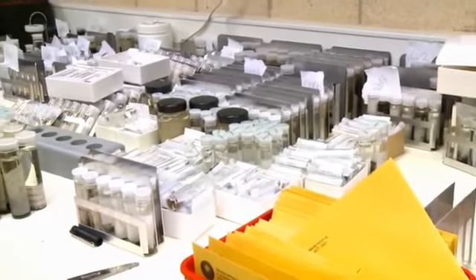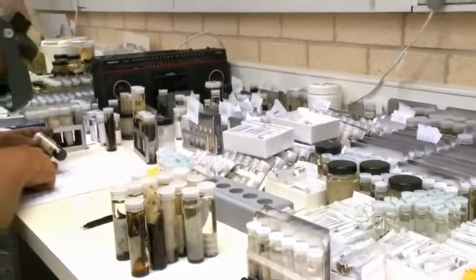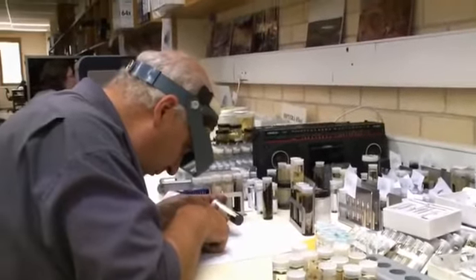The pollen microscope is also expected to make a big contribution to a very ambitious project. The Atlas of Living Australia is going to be the largest integrated aggregation of information about Australian species in forms that can readily be reused by researchers.